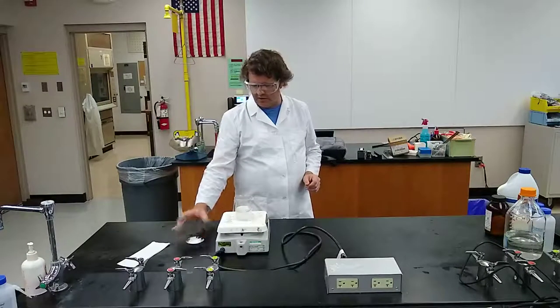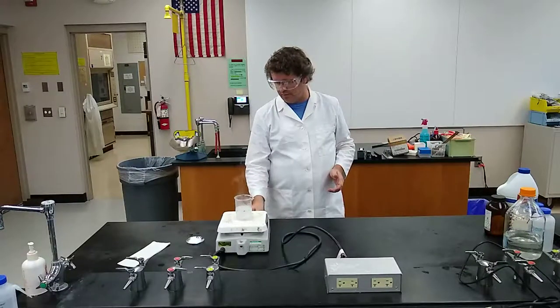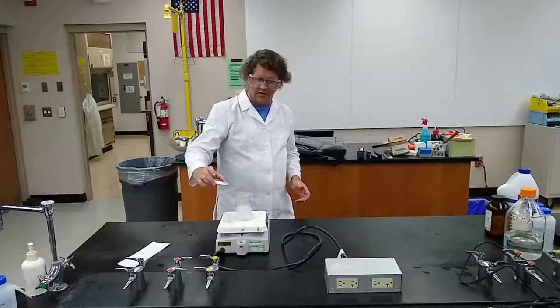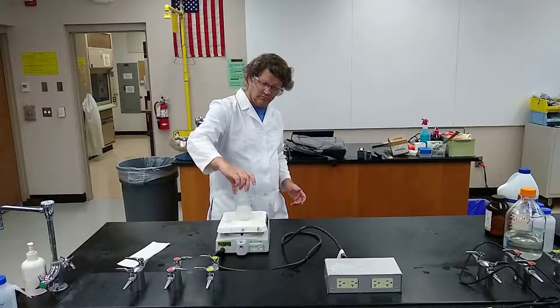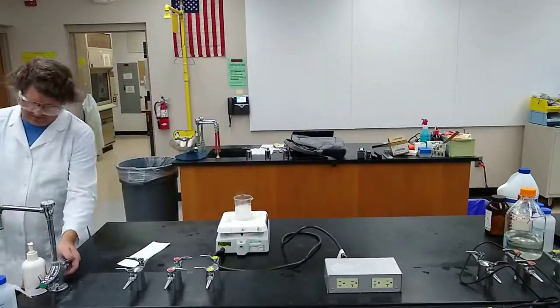I set it on the highest setting and it just started really boiling. I'm going to turn it off the heat now — I'm watching it — and right now I'm putting the starch in. I didn't get it all in at first, but it's still going. I'm going to rinse off the watch glass; don't worry about getting starch on it, it's not that big of a deal.